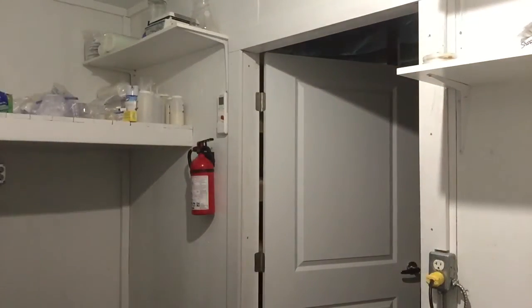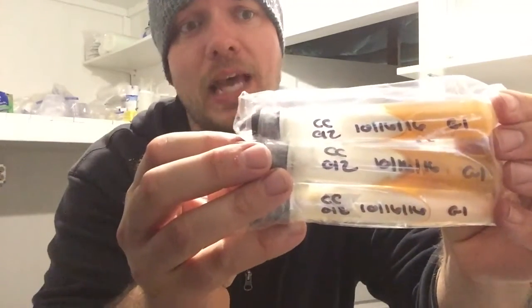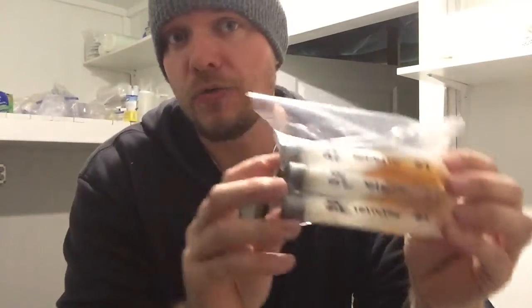And then for cultures, we just store everything in the fridge, and everything is in test tubes. And this strain is a shaggy mane strain. So CC is Coprinus comatus. This happens to be strain 12 in our library, and we record the generation that this strain has been transferred since it was either transferred from a clone, so from a wild tissue of a mushroom, or if it was created from spores or what have you. So this one I actually happened to create myself. So this is a local strain. I'd have to look into my notes to see exactly where this is from, because I do carry actually 3 local strains of shaggy manes from all over the Okanagan.